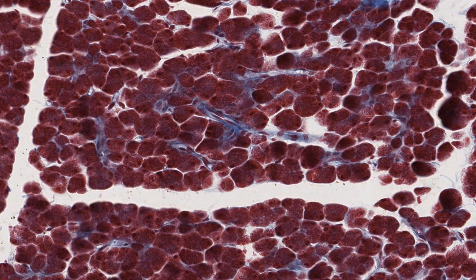The centroacinar cells appear as cells with an elongated nucleus and are an extra nucleus or two in the middle of those acini which have been sectioned through their center. You can see the odd one here and here. They and the other intercalated duct cells secrete an alkaline fluid under the command of the hormone secretin to help neutralize the pH of the material passing into the duodenum from the stomach.